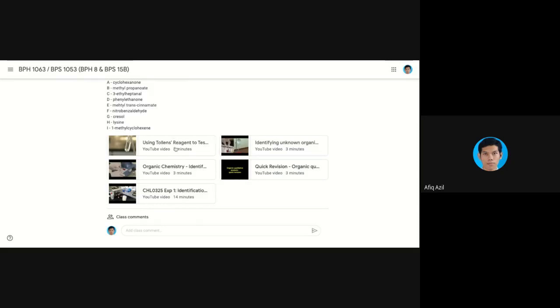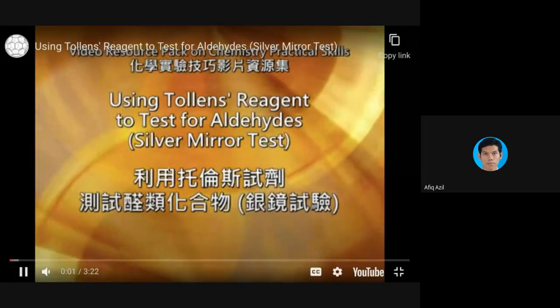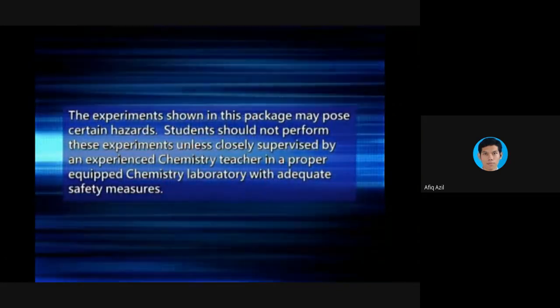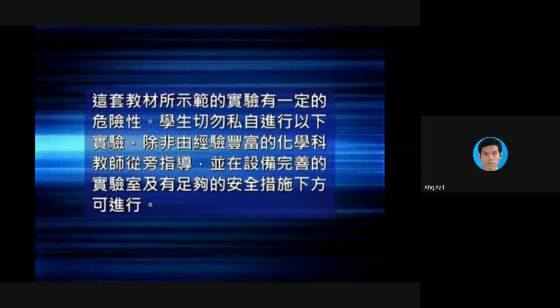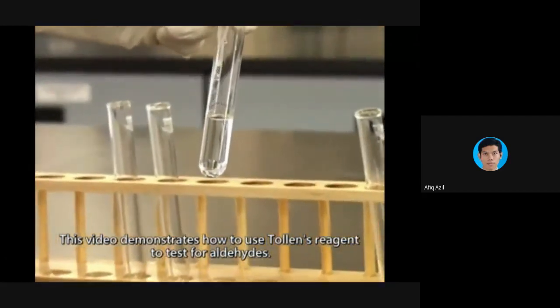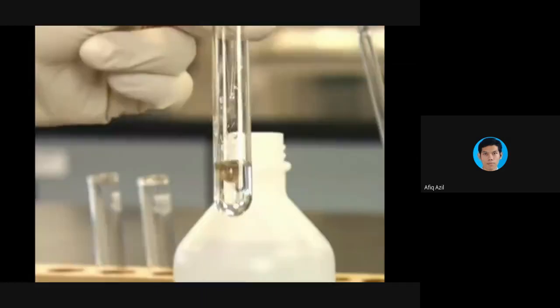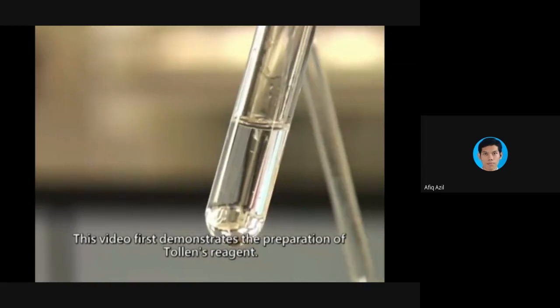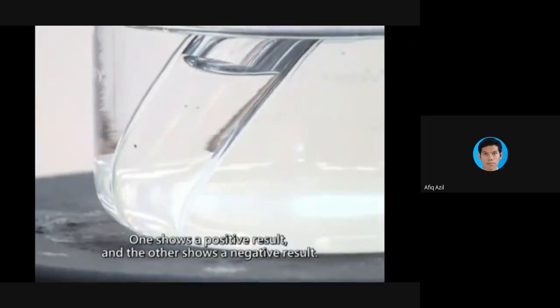I'm showing you this. This one is the example of doing a Tollens test. Using Tollens reagent to test for aldehydes. The silver mirror test. This video demonstrates how to use Tollens reagent to test for aldehydes. This video first demonstrates the preparation of Tollens reagent. Two tests will then be carried out. One shows a positive result, and the other shows a negative result.